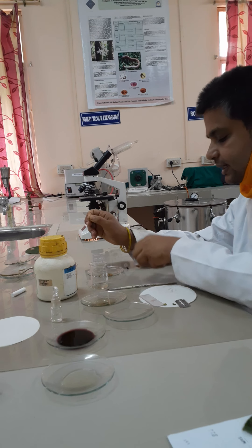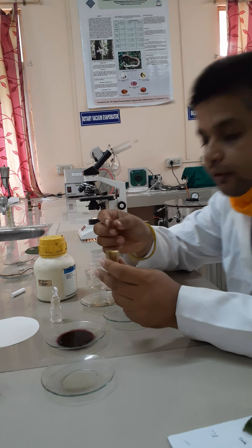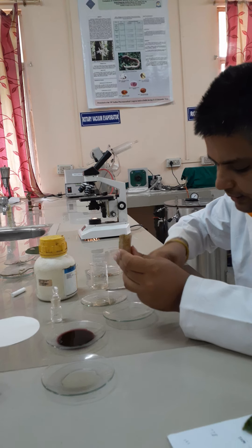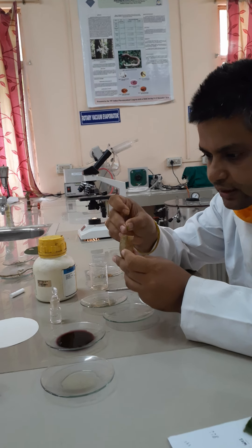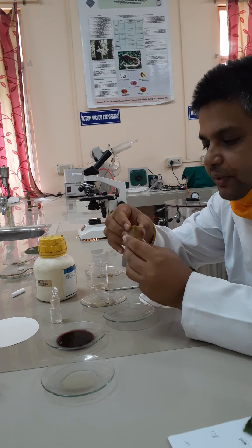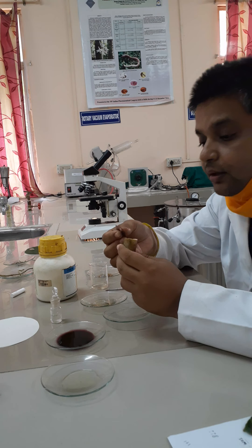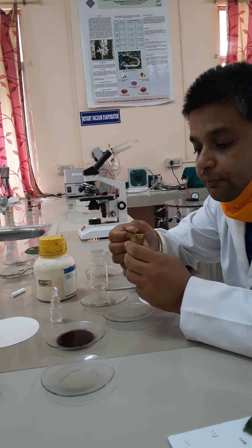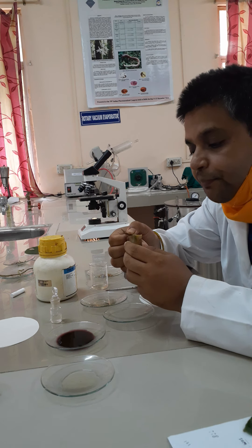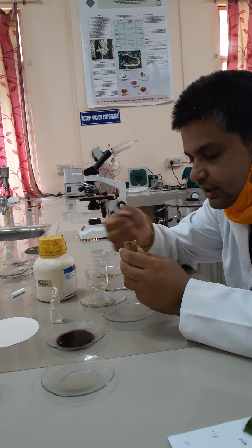Inside the potato, make one small division with the help of the blade, and the square section of the leaf is placed inside it. The leaf is present in between the parts of the potato — that is why it is known as the sandwiching technique. With the help of the blade, you then take the transverse section in this fashion.